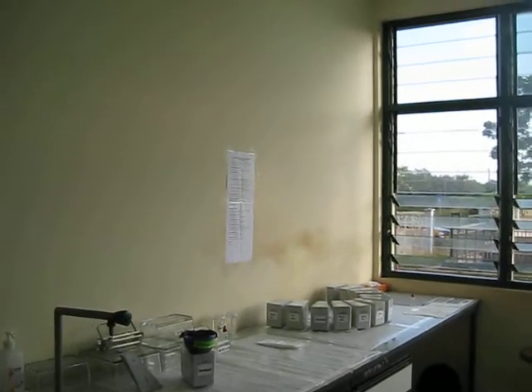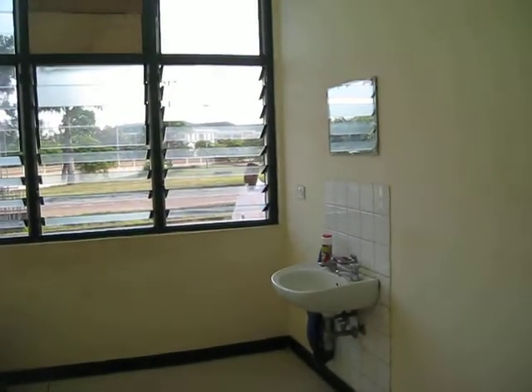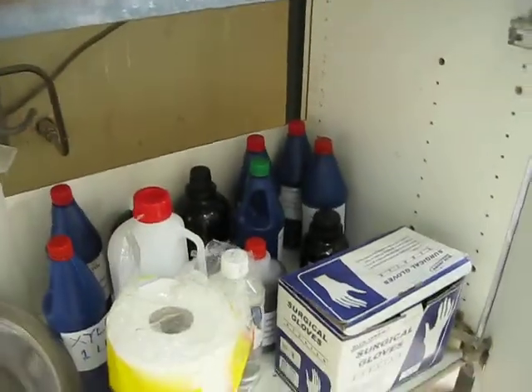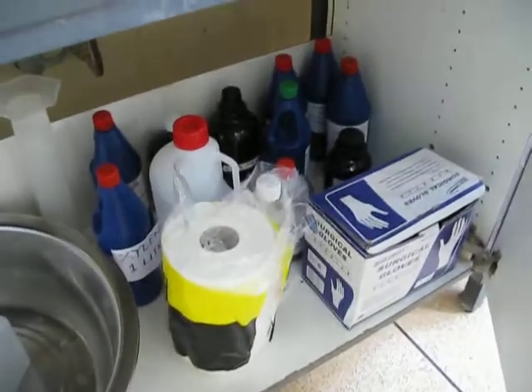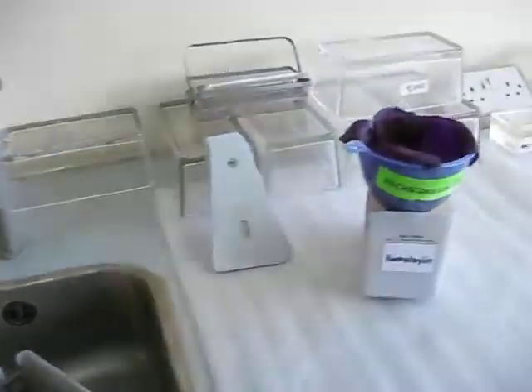This is a short video to show a cytology lab in a resource-limited setting. As you can see, this is a small room with a sink, a working area, storage cabinets for all the reagents, some kitchen paper which we find very useful, and a sink again on the working table.